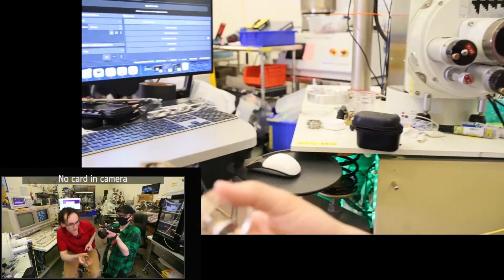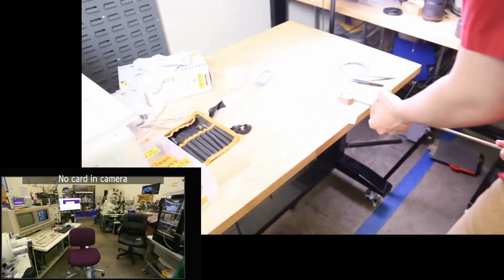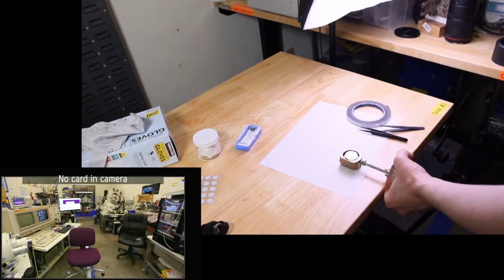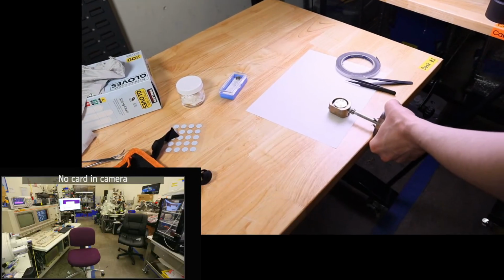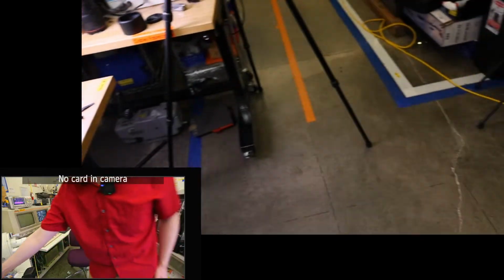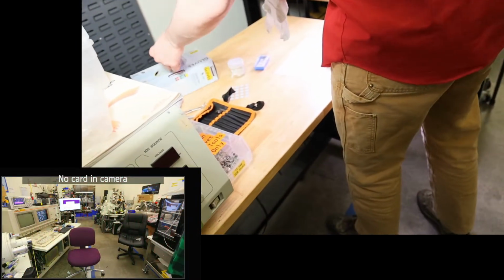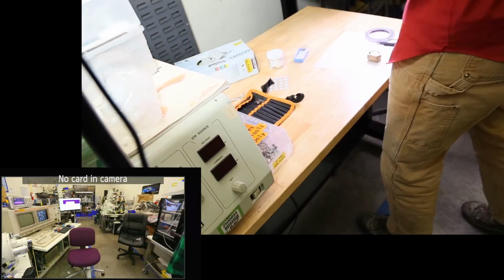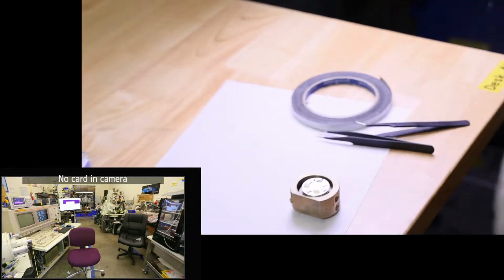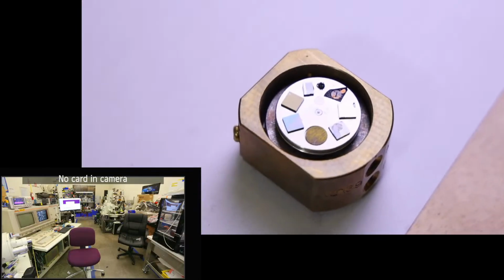So now we're going to head back over to this bench. We'll just set it on the bench and unload it. Return our sample exchange rod. So that's the calibration sample we had in there. That's a FEI calibration sample.